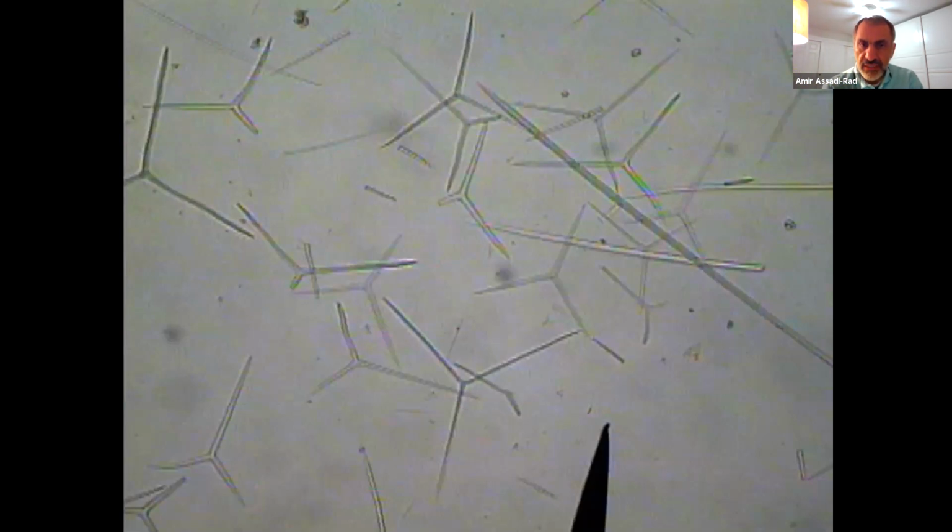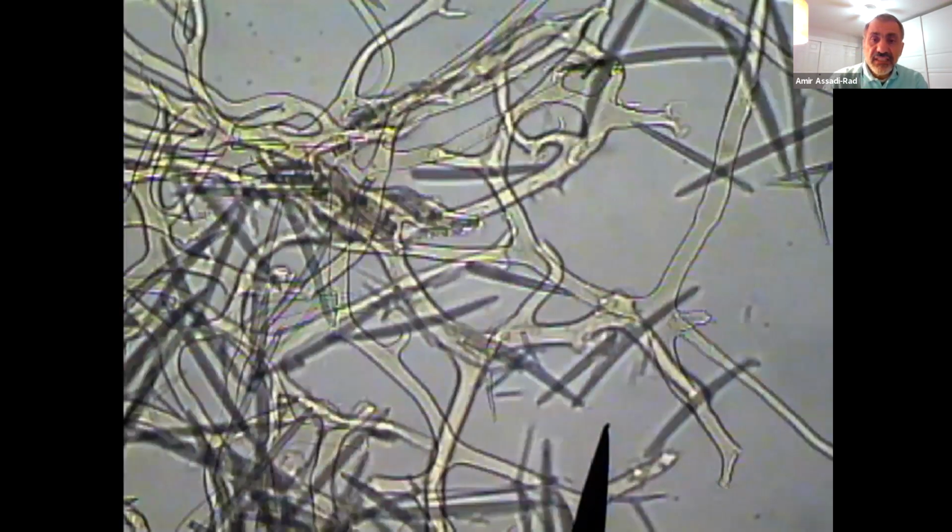And that is why, as you can see, other animals do not like to eat sponges, because of these spicules. Okay, in this diagram, you have a combination of both. These are spongin, and these are spicules. So you have both of them in here.